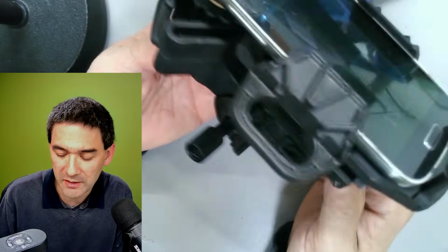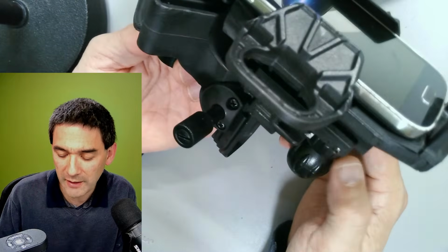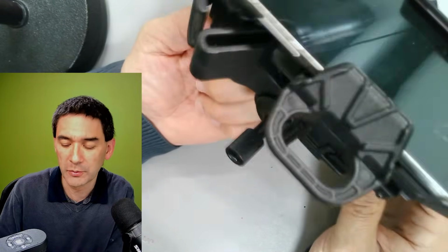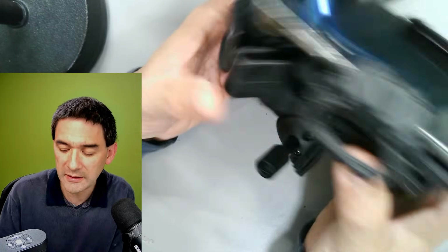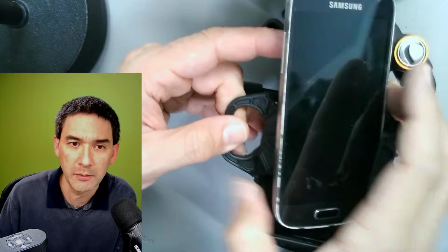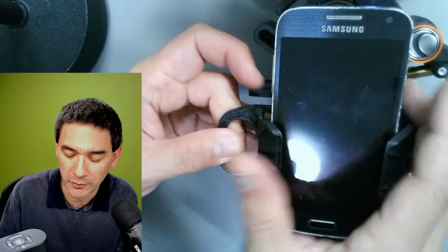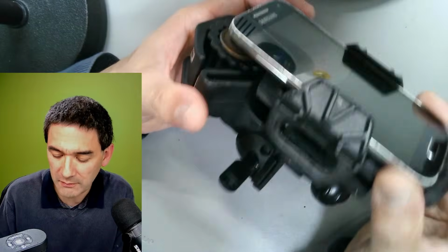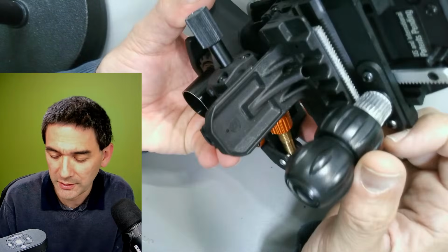However, this is a huge thing, and it's quite heavy. So you have to be a little bit aware if you put this onto a microscope. There is a little bit of tension on the eyepiece. Maybe on the photo tube, that would be a possibility, but most likely the whole setup and the adapter is heavier than the actual mobile phone. And then once everything's set up, you can easily drop in the mobile phone and take it out again. So that is another one that we've got here.